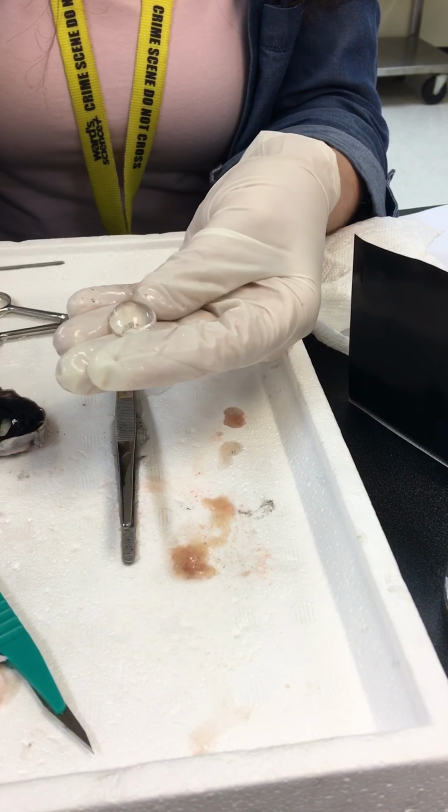But it'd be hard to see because it's very, very clear. If I took a slice through there and put it under a microscope, you would see the tissue layers would be pretty much like an onion. It's not like a sac filled with fluid, but most people think it's a sac filled with fluid. It's really not. It's solid. It's a very solid piece. And I was really hoping we'd see some of those ligaments on there, and I don't know that we're going to be able to see them or not. I was trying not to damage too much. Okay.